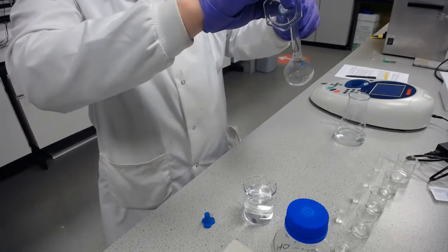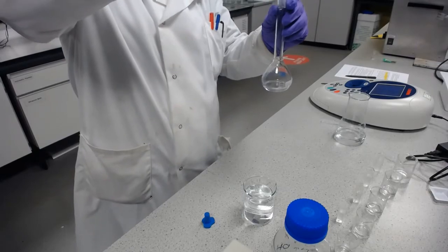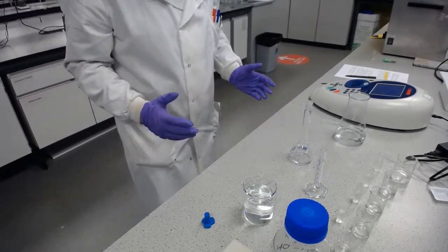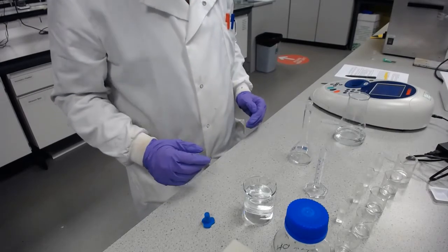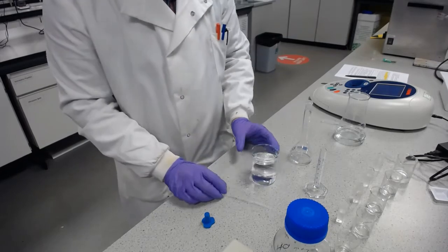So a calibration is only as good as its limits. As soon as you start assessing concentration outside of where you set your calibration limits of maximum concentration, you start to introduce more error into what you've done.